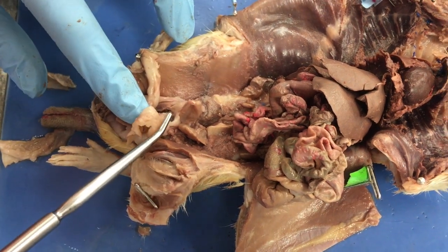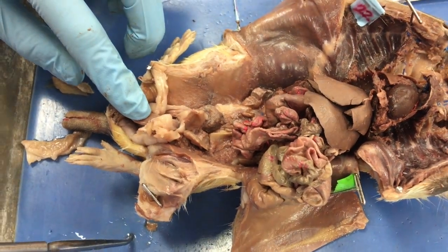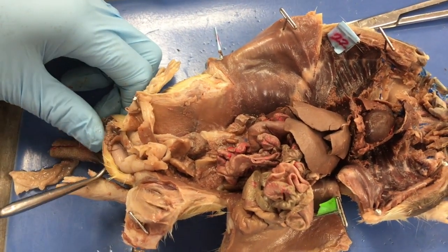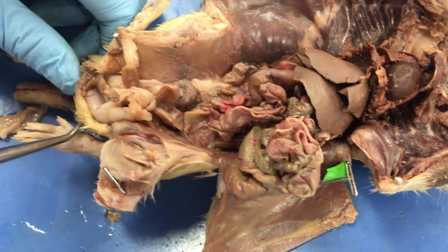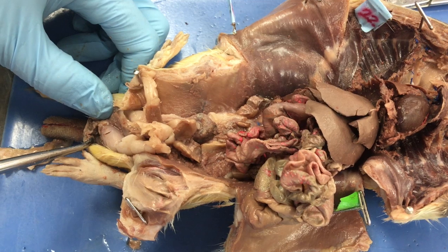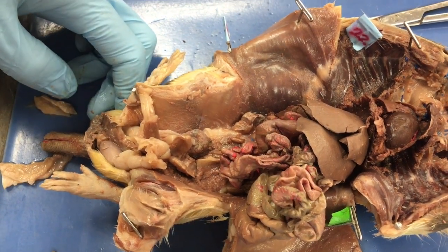That happens there. Brooke, did I grab everything? Did we talk about the scrotal sac? Scrotal sac wasn't cut open. So this is the scrotal sac. So that's all the scrotal sac, and then when I cut him open, that's what I found hanging out on the inside. Okay. And then ureters.